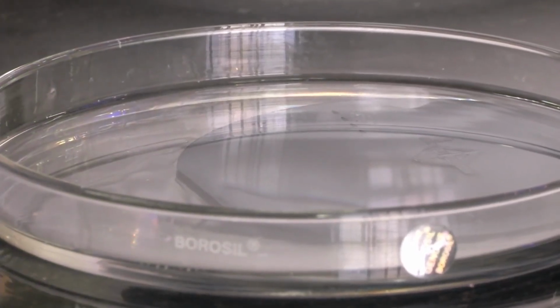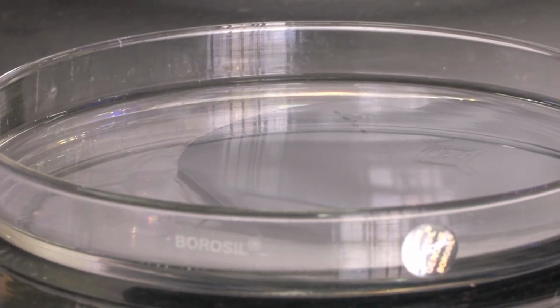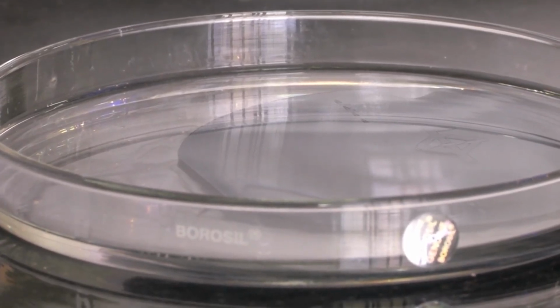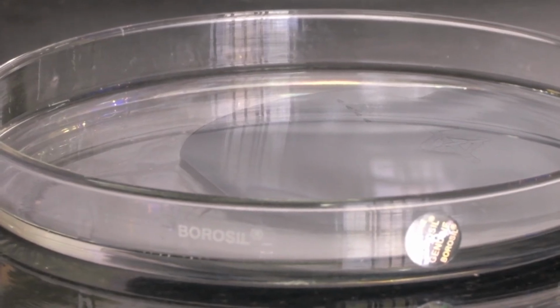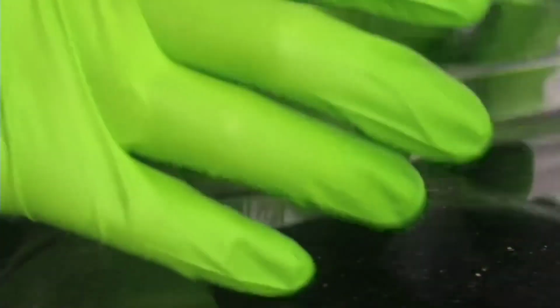What do you mean by curing it? We have to keep this at around 70 degrees Celsius for a couple of hours, 2 to 3 hours. The PDMS will solidify, it will undergo a chemical change so that the physical properties will change, and it will become a solid rubbery material which we can stick onto another surface like a silicon wafer or a glass slide. So let's keep this inside the oven.